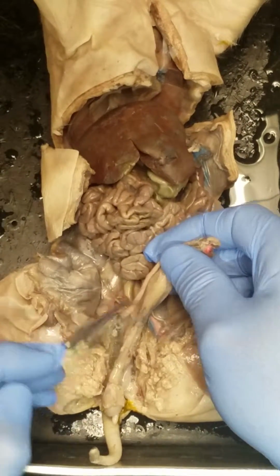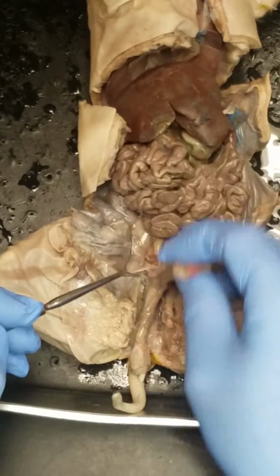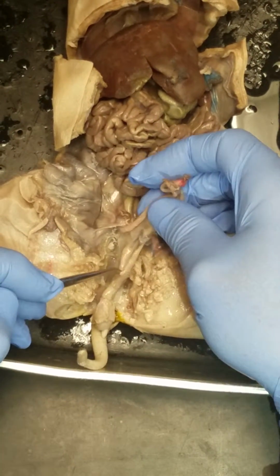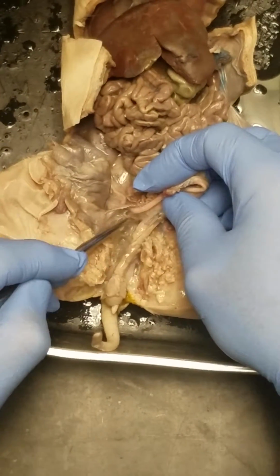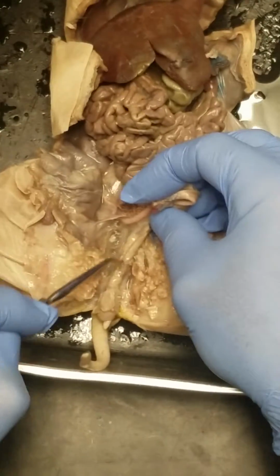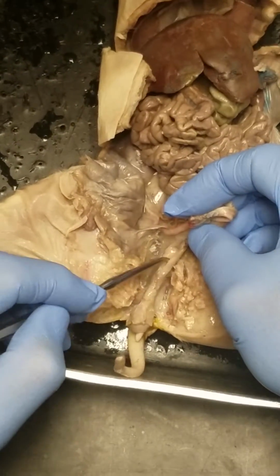That's my bladder. You guys have by now seen the bladder enough times, between the two umbilical arteries. That's the bladder. And then out of the bottom of the bladder is going to come a urethra. So there's the urethra. Where the urethra joins this structure right here, from here on, this one is a long vaginal vestibule. So that's the urethra where these two come together. From here out is vaginal vestibule.